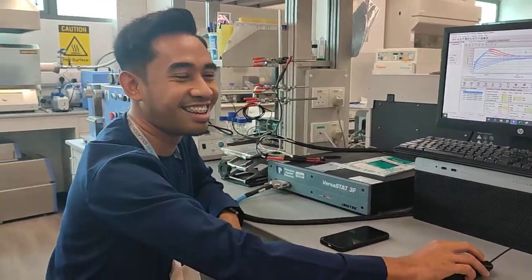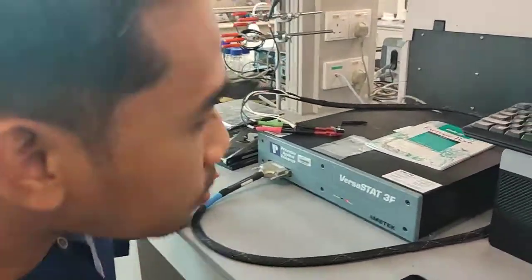Wow, yes. Very interesting, Dr. Amirul. Can you show the setup? We want to see the setup.